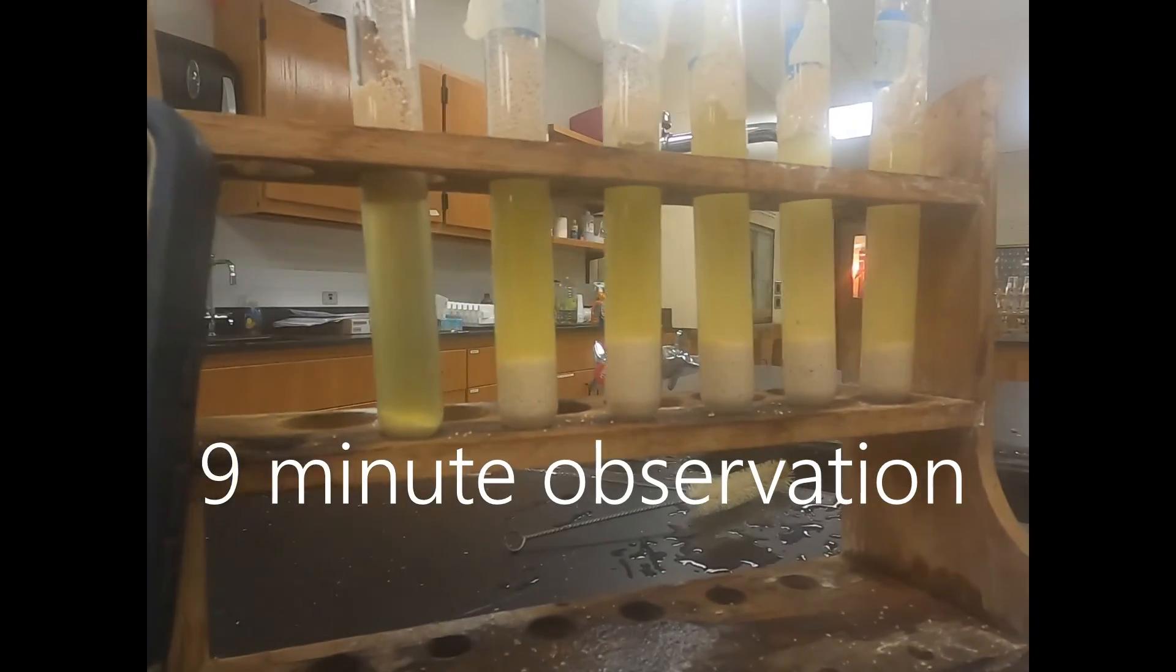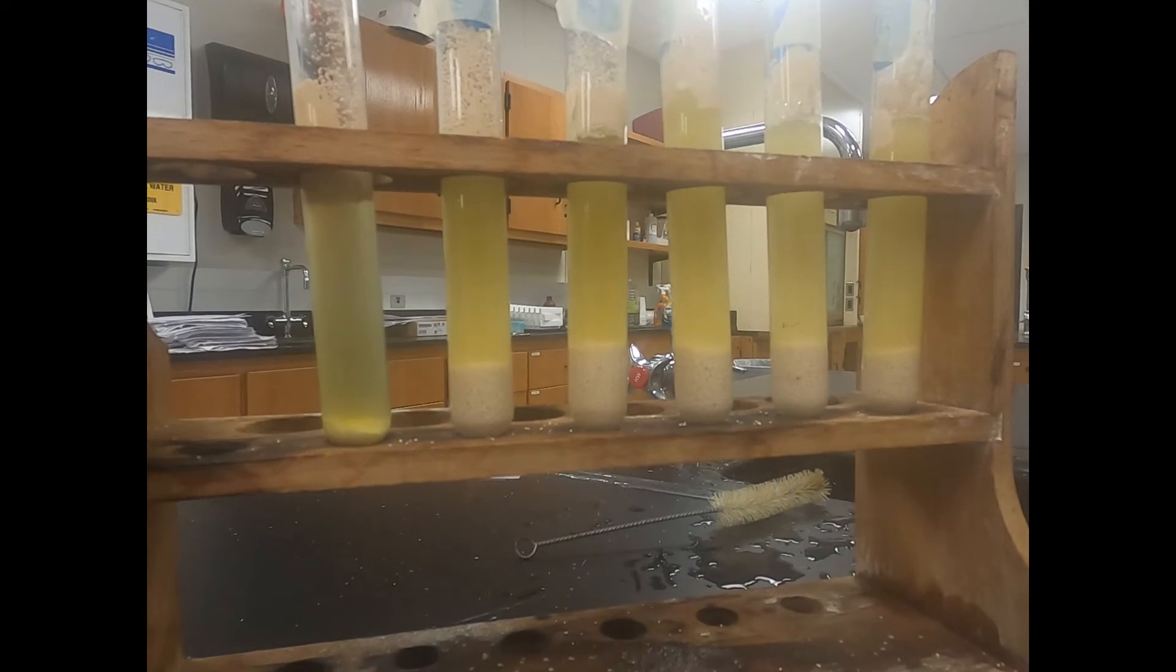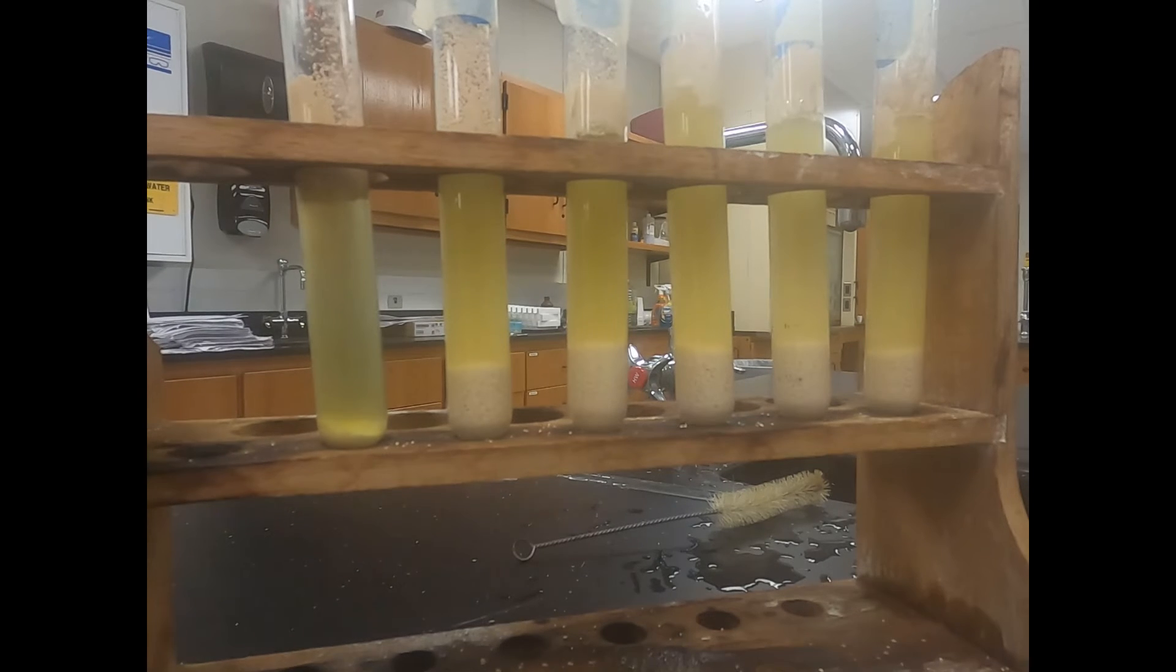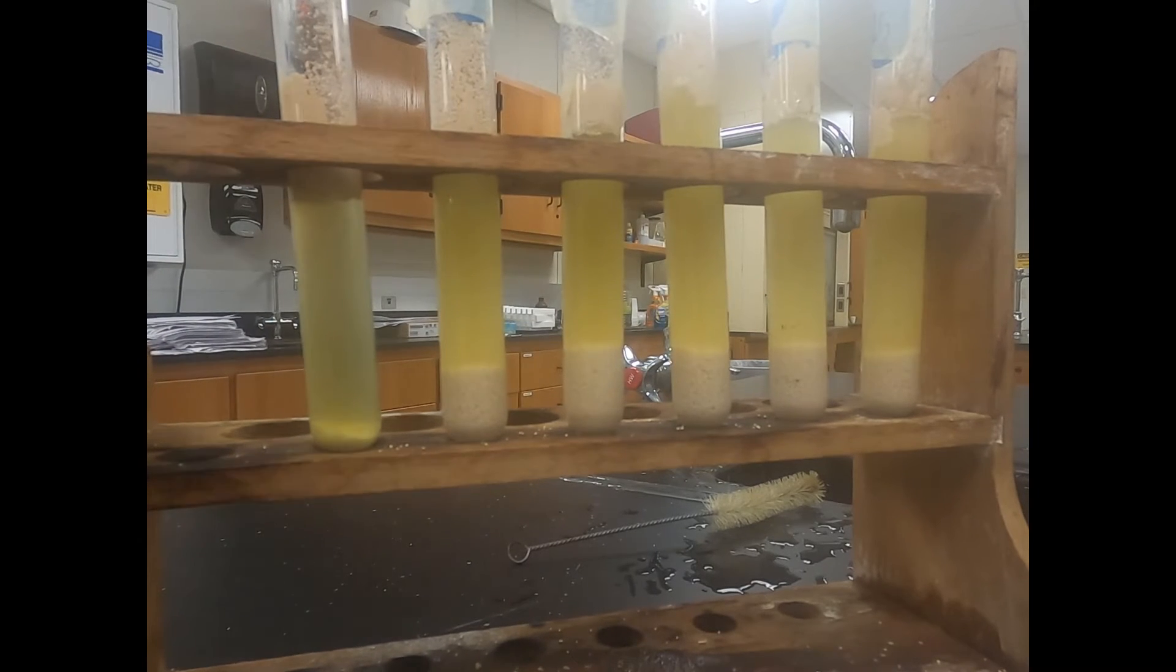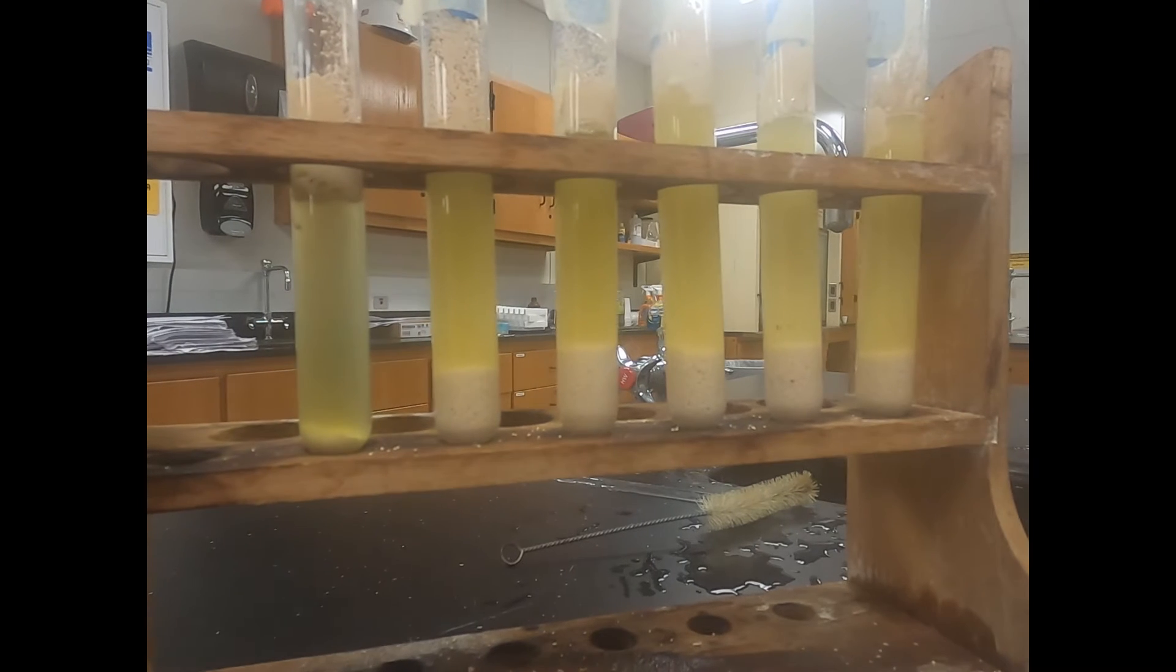Now it's been nine minutes so again we want to record our observation. We're looking for differences where things are darker, where things are lighter. In this case definitely at the zero end, it definitely still has some green appearance.